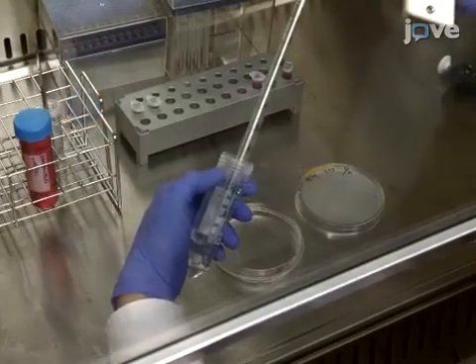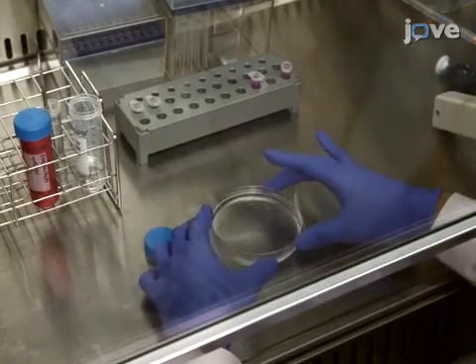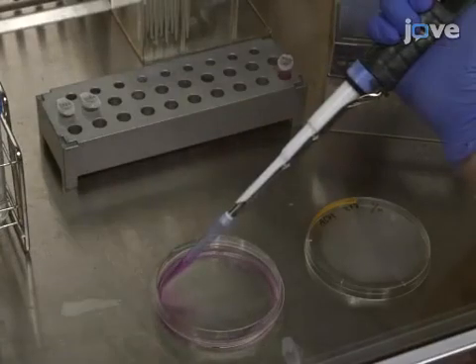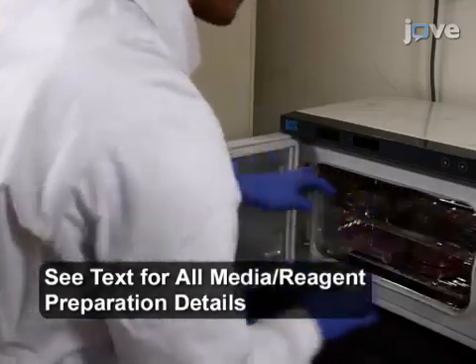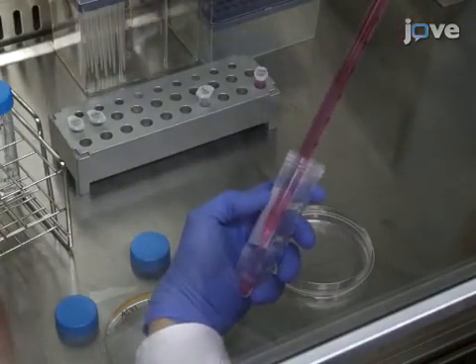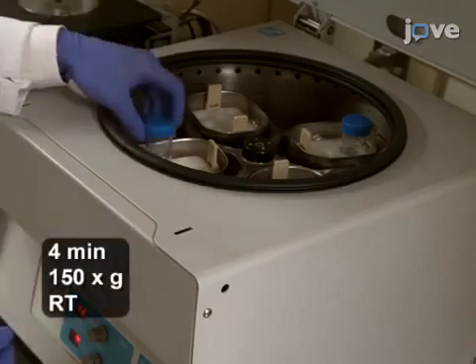Begin by washing a culture of A549 human lung epithelial cells with 5 to 10 milliliters of PBS. Next, detach the adherent cells with 2 milliliters of trypsin EDTA at 37 degrees Celsius and 5% carbon dioxide. After 3 minutes, transfer the cell suspension into conical tubes containing cell culture medium and spin down the cells in a centrifuge.